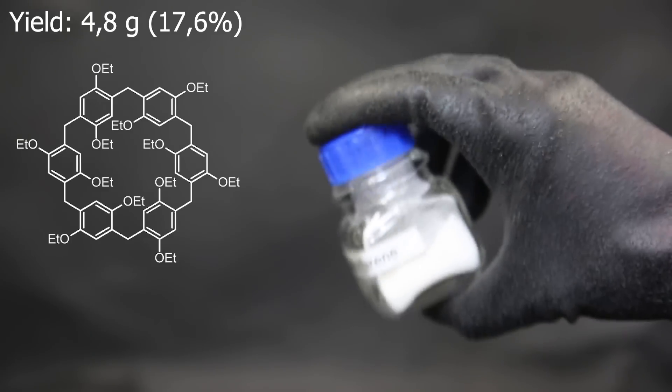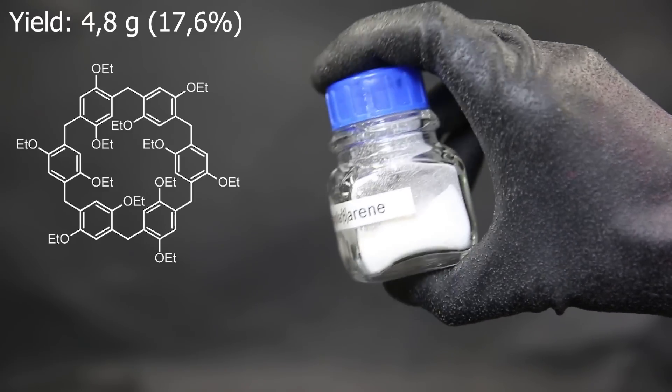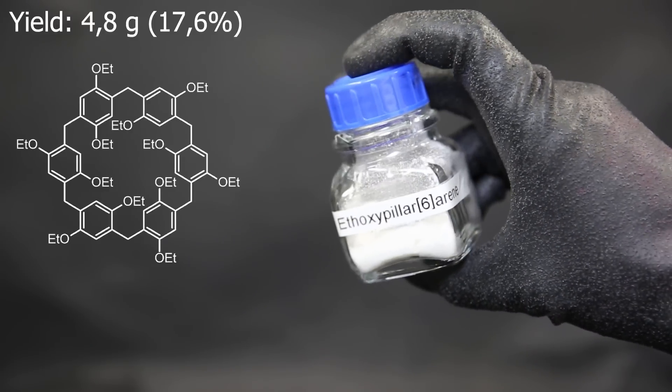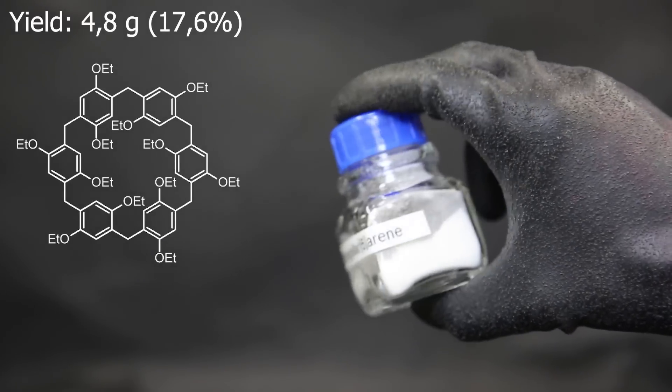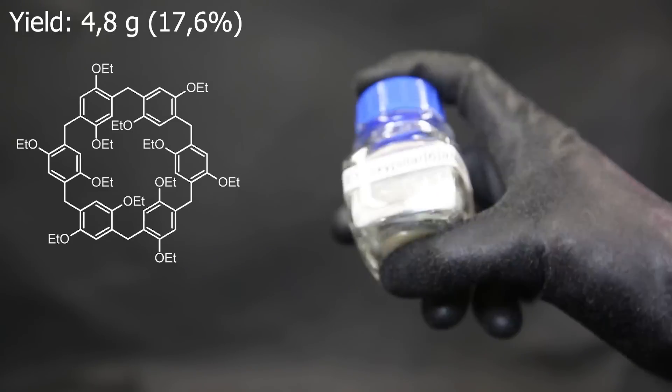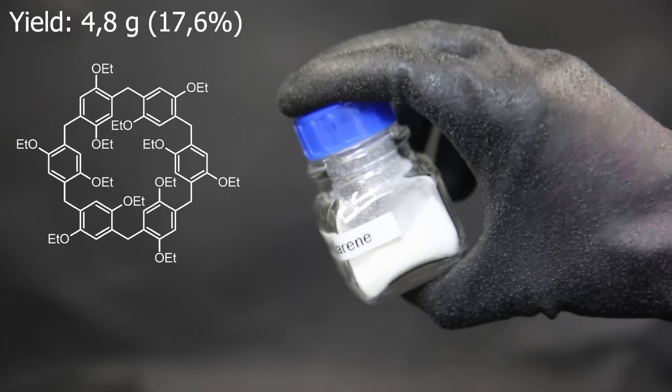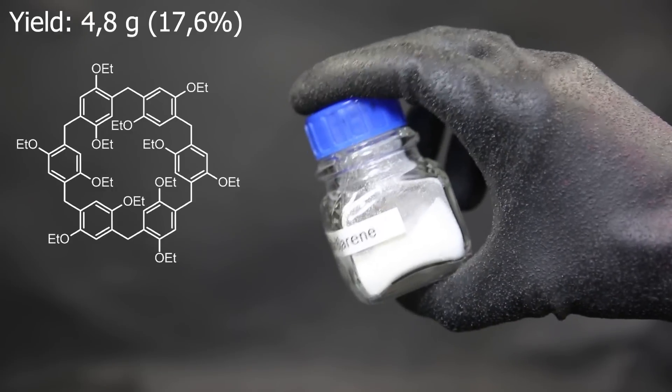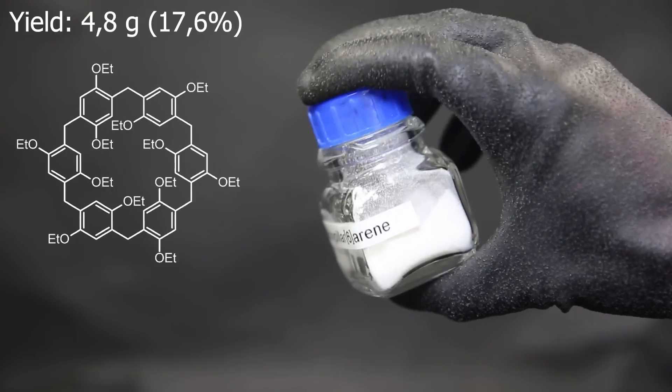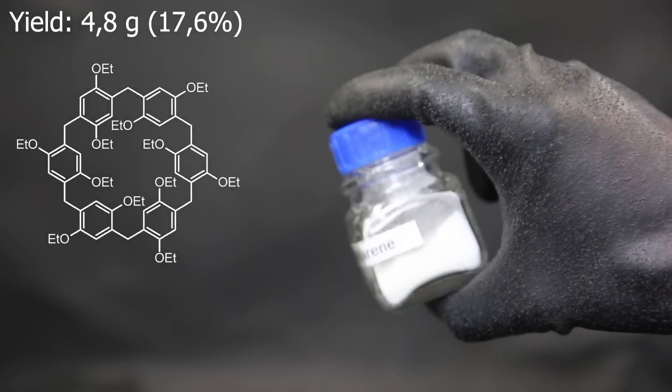Compared to the procedure, there were a few differences. Mainly that the color of the residue and the filtrate didn't fully line up throughout the process. Also, my powder was a lot more white than theirs before the recrystallization. I also spilled a little, and I didn't wash as much as them since I ran out of DCM. So my final yield is 17.6%, compared to their 31%, which is pretty decent all things considered.